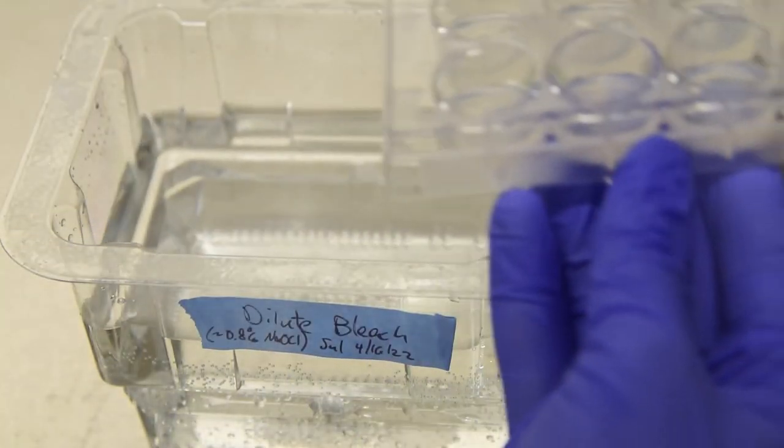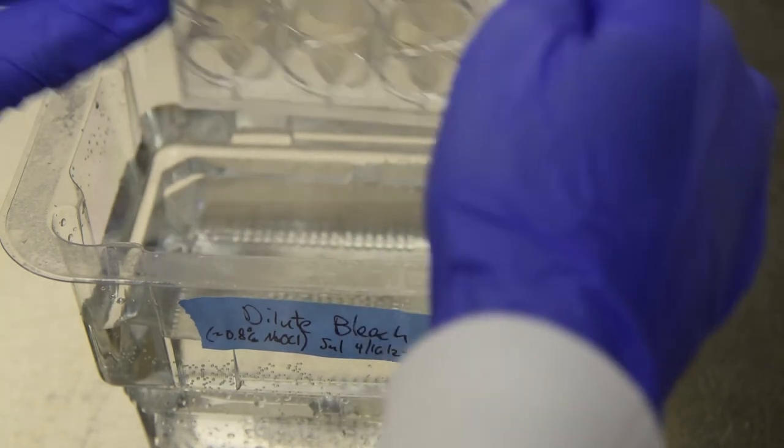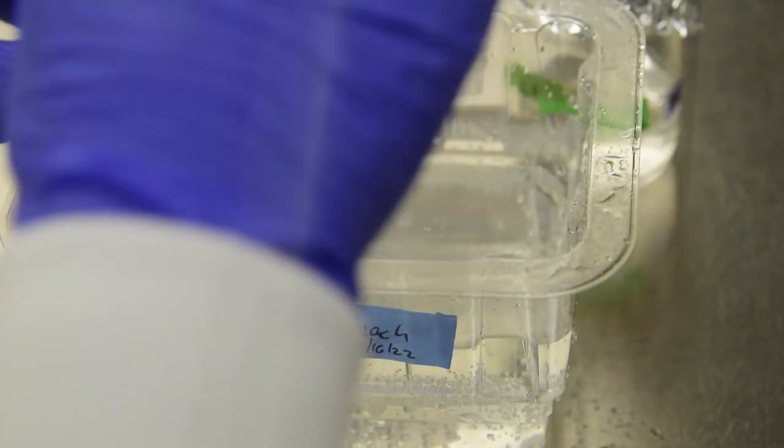After the plates are dry, dump the glass beads from both the plates and the 12-well co-culture plate into dilute bleach for cleaning and reuse.